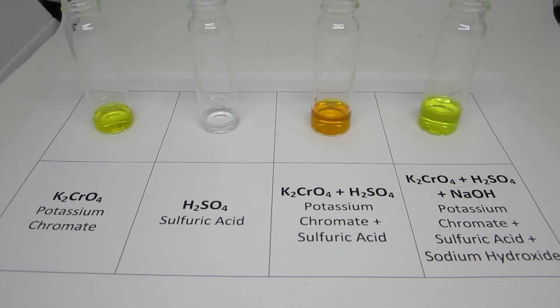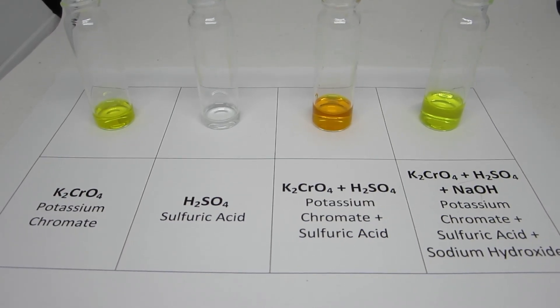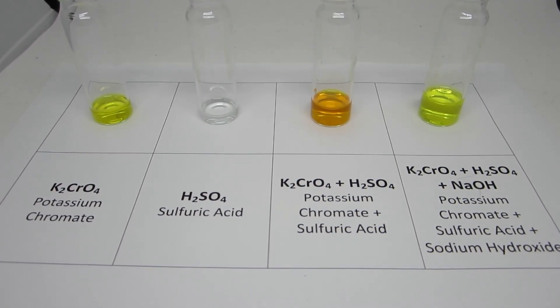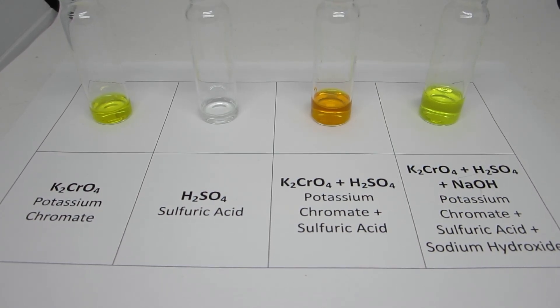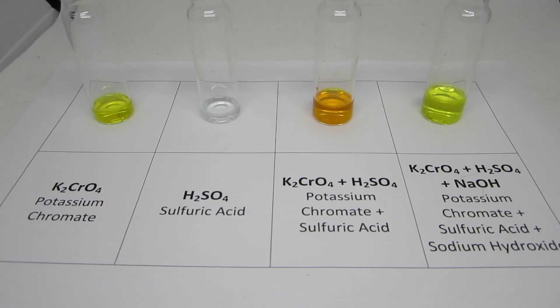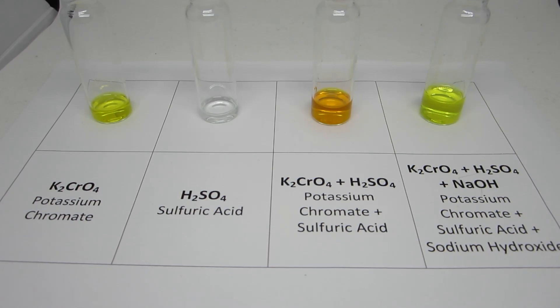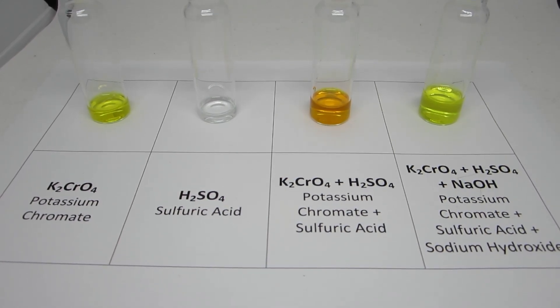Overall, the yellow potassium chromate reacts with colorless sulfuric acid to form the orange dichromate ion. When additional reaction takes place with sodium hydroxide, the orange color dissipates and forms the yellow chromate ion.